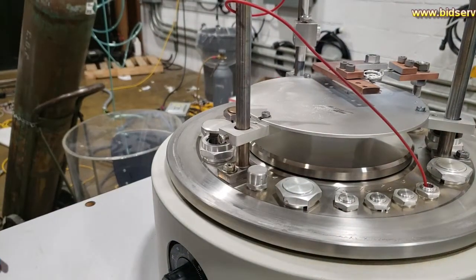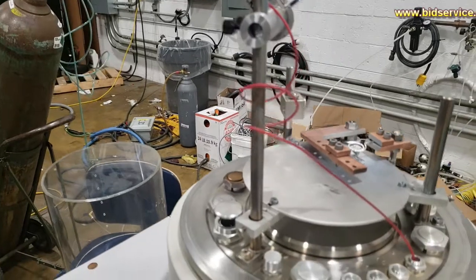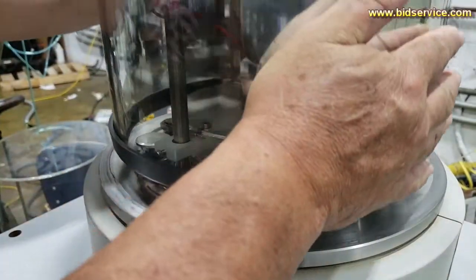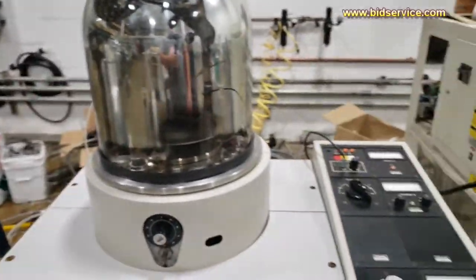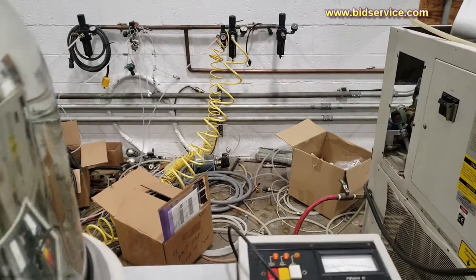And there's your bolt inside. If you want to pump down on the system, I'm going to put the bell jar back on. I'm not going to put the implosion guard on. What I'm going to do is turn off your vent valve.